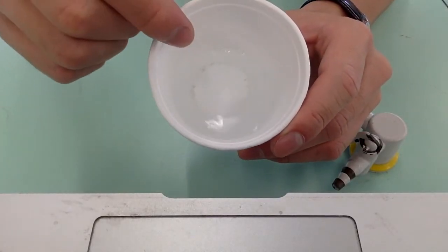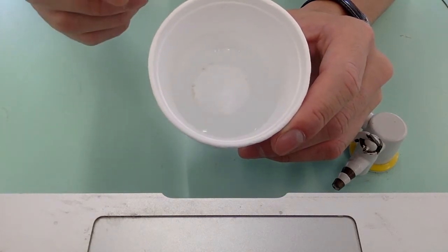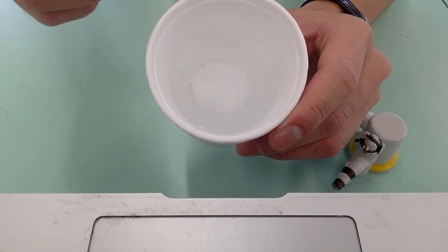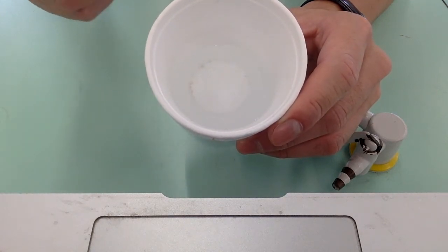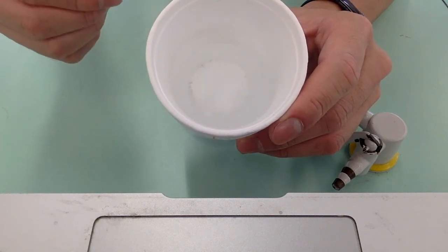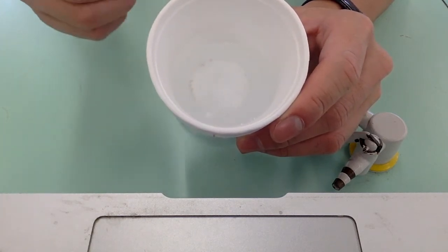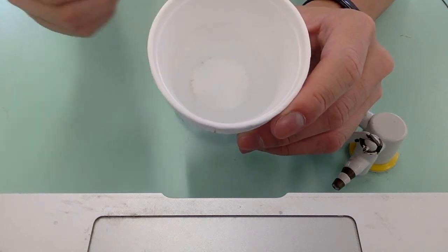Now, you may see that some grayish solid remains undissolved. That means there could be some impurities or some other chemical substance in the calcium granules. So that may account for some errors in your experimental results.